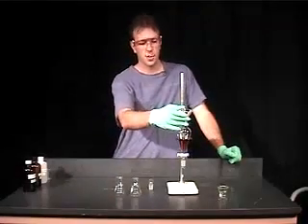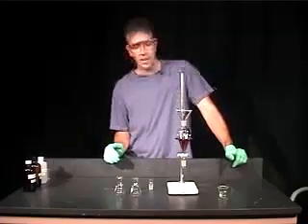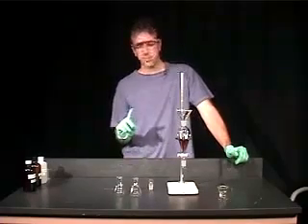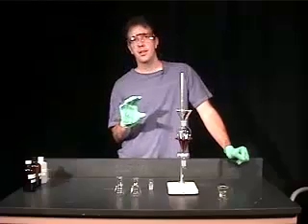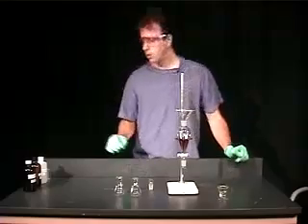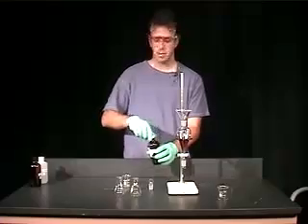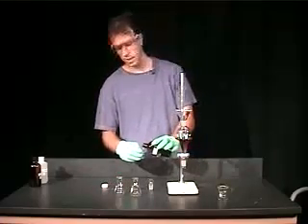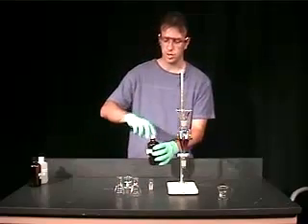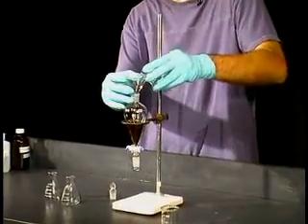At this point, we want to add our solvent. This is an aqueous solution, and I'm going to extract this caffeine using two different organic solvents. The first one is ethyl acetate, and the density of ethyl acetate is lower than water. So it will remain on the top of our aqueous solution. I'm not measuring out the volume here. I'm just going to add a certain volume just to show you the technique. I'm going to use the same funnel and pour this in there.